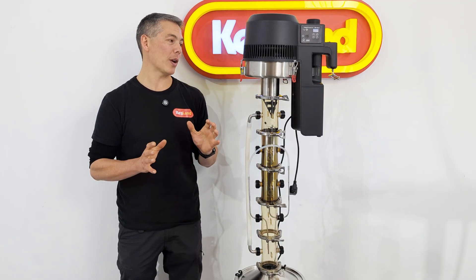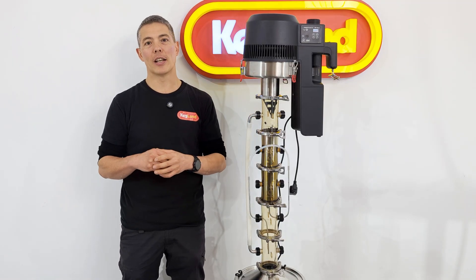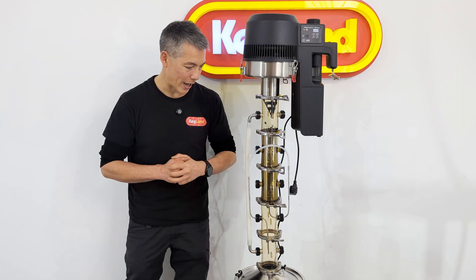The other thing is we're using the air still today as well. Rather than having the hassle of using water to cool my column down, this particular Soxhlet extractor is just air-cooled. So plug it in, away you go — it's really simple.